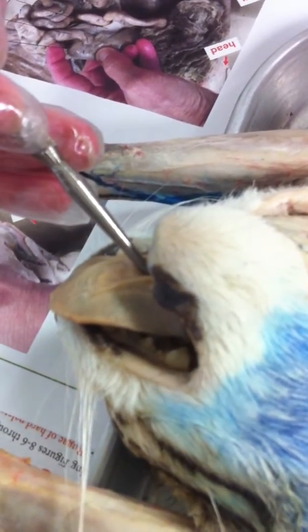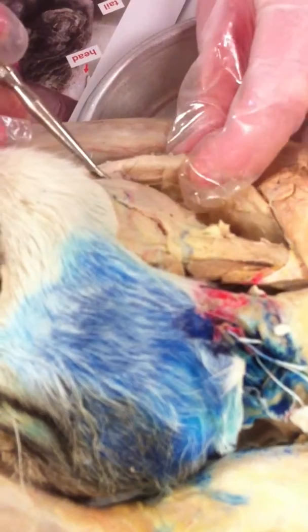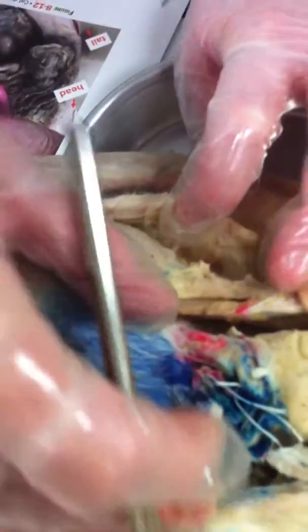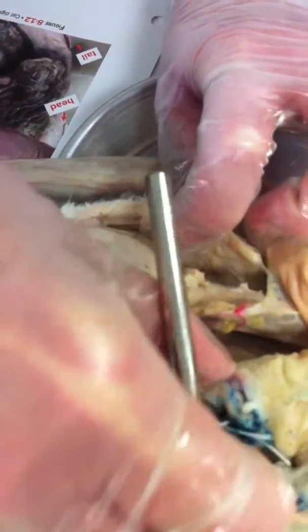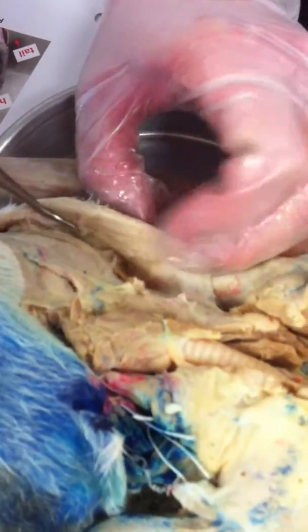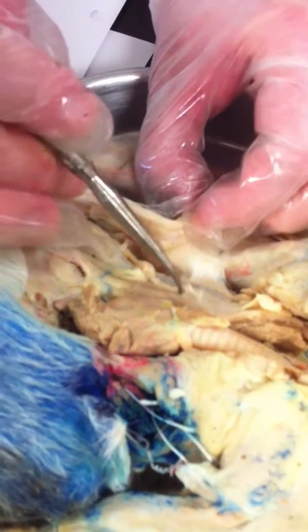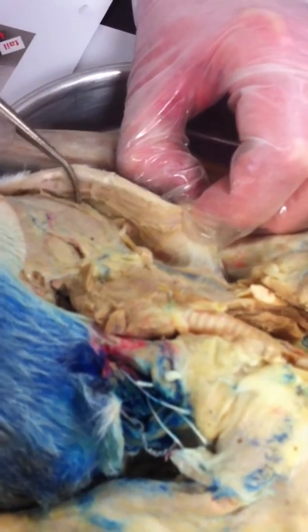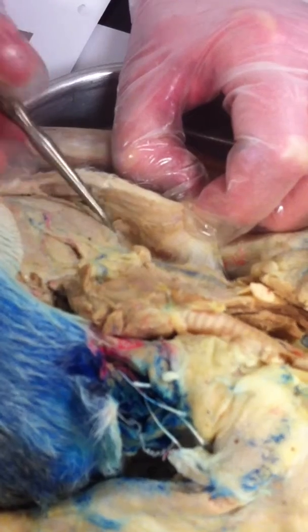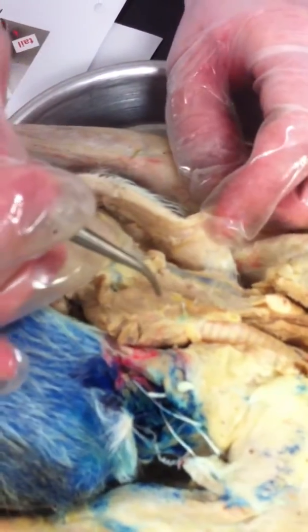What's next on your list there? The masseter. The masseter is a big cheek muscle here. This cat does not have salivary glands that show up very well, so we'll have to see those on another cat. I don't like the way these are showing up. And it's Miss Ramey's cat, so I don't want to chop the other side. Sometimes they show up really well, but not on this one. Okay, so we're going to skip the salivary glands.